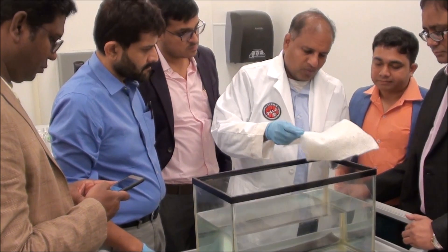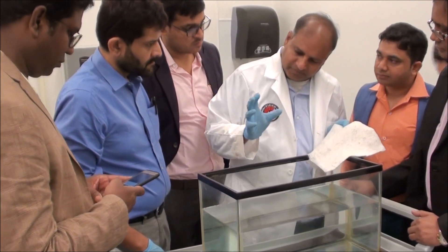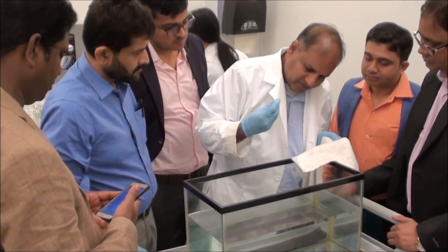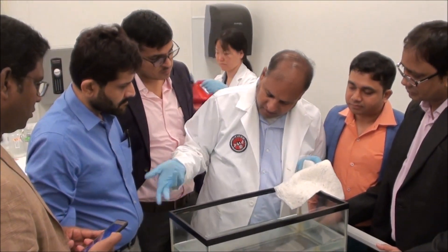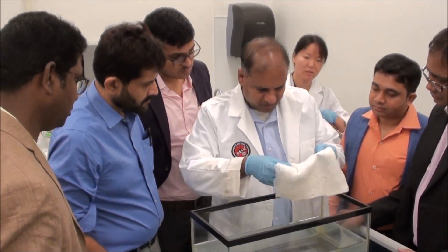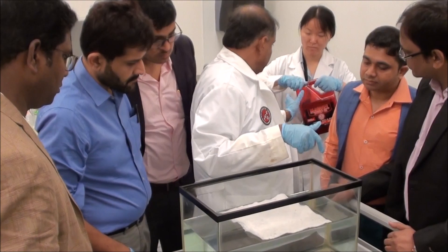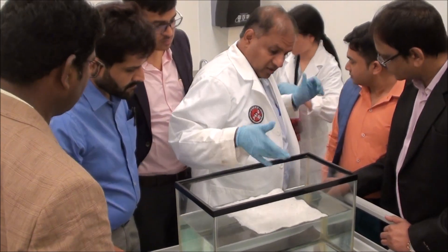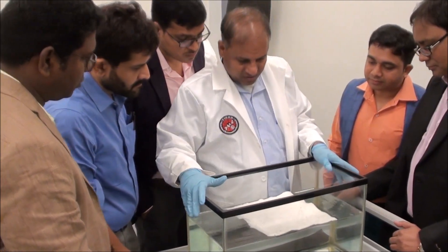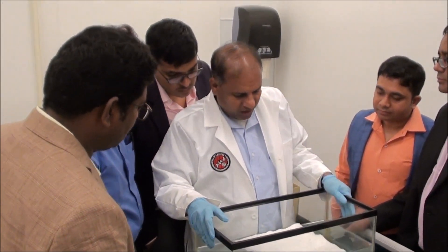Give me the oil. So what happens when you take cotton — normally it will take the water. That's why you wear an undergarment made of cotton. But this will not sink. So this is the basic thing you should know.